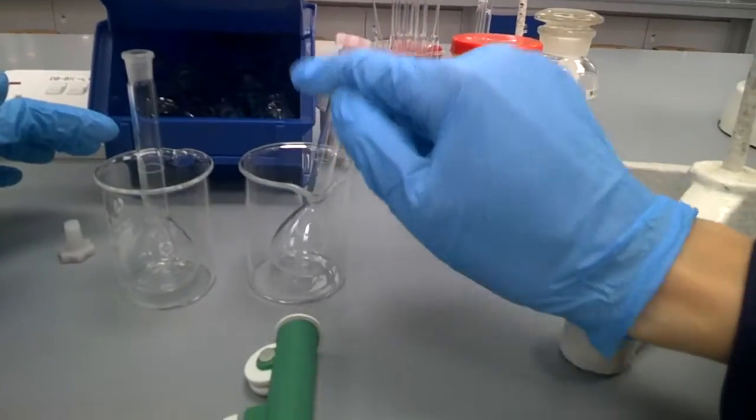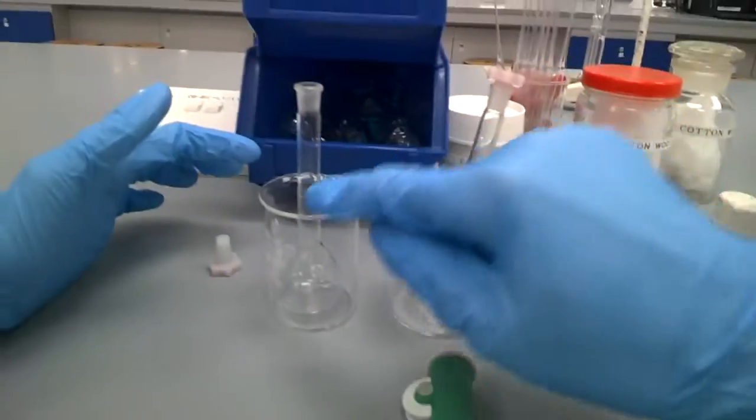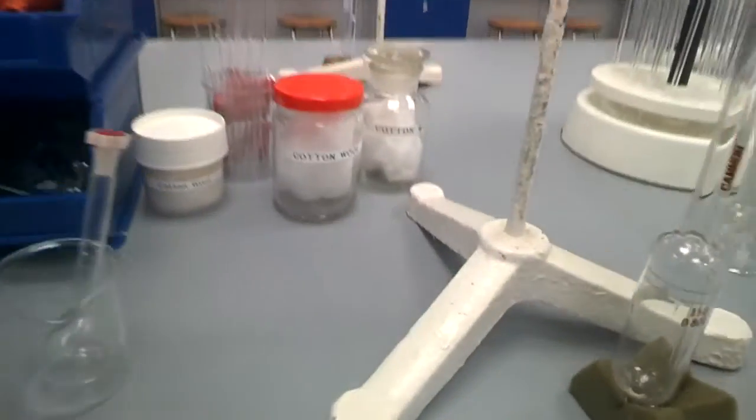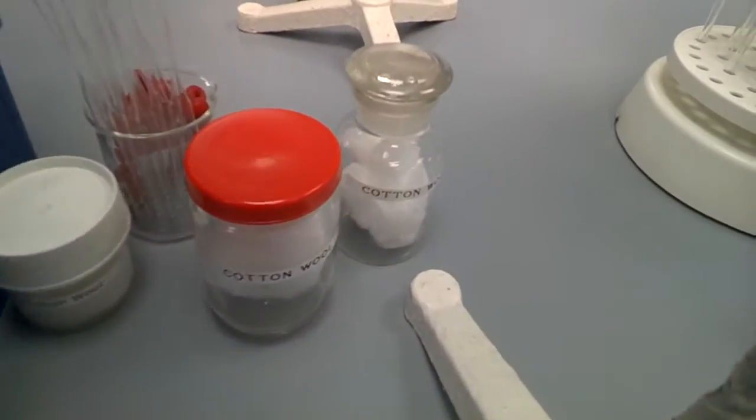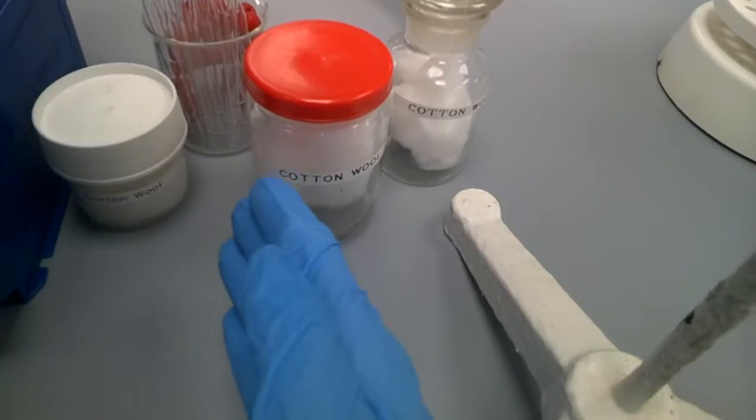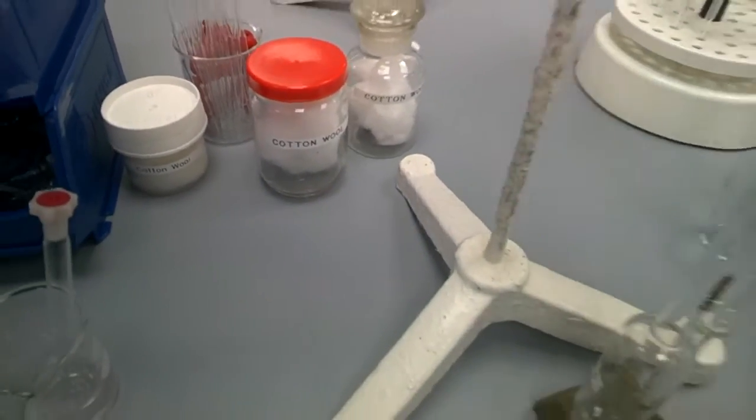Next, you need to have your cotton wool here to filter your polymer solution through it to take away any possible solid, because we do not want any solid to go into this viscometer.